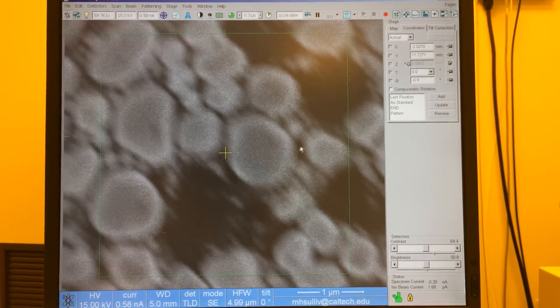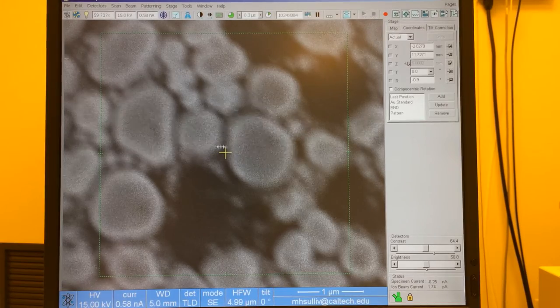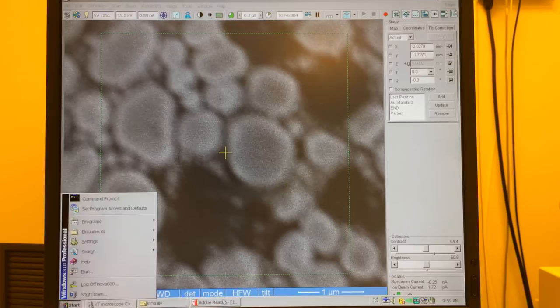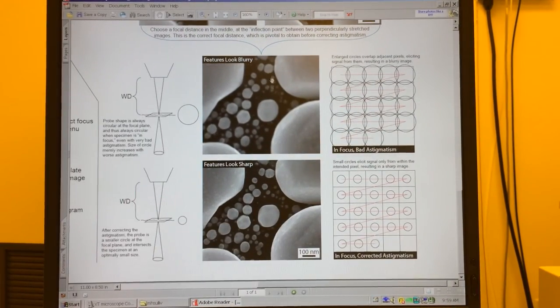So I want to go in between the two stretching sides where we have equal blurriness along the edge of our particle. And if we go to our diagrams, we can see that now I'm in this situation here. So at focus, we always have a circle, whether we have an ellipse above and below, it's always going to be a circle at focus. If we have astigmatism and we have that ellipse above and below, it just means that our circle at focus is going to be artificially large.